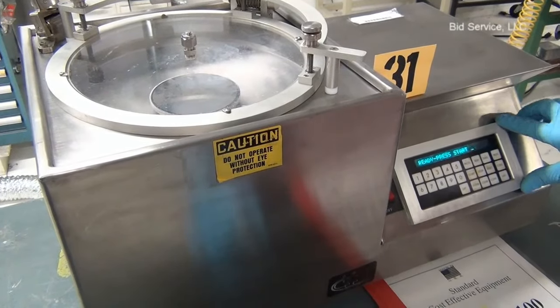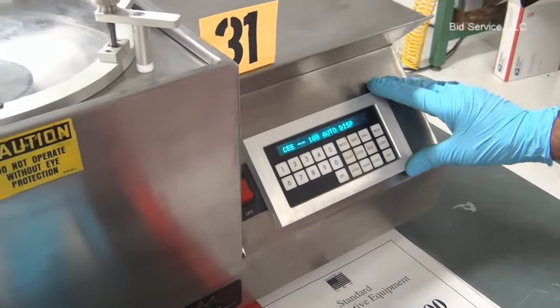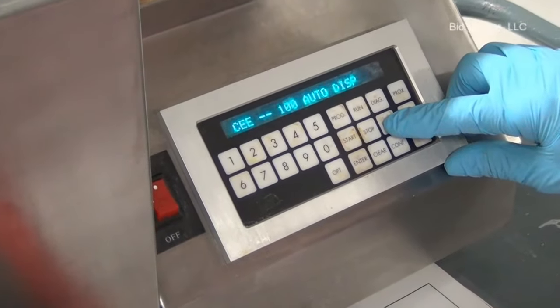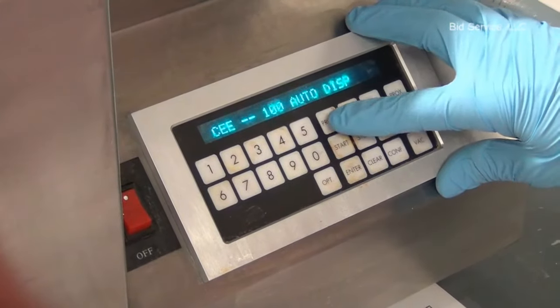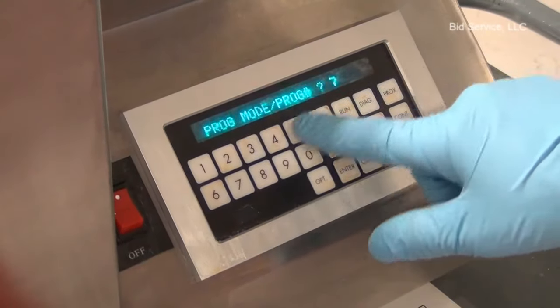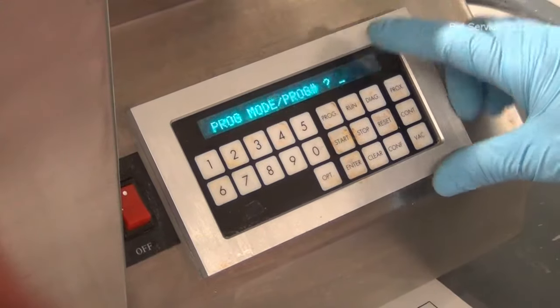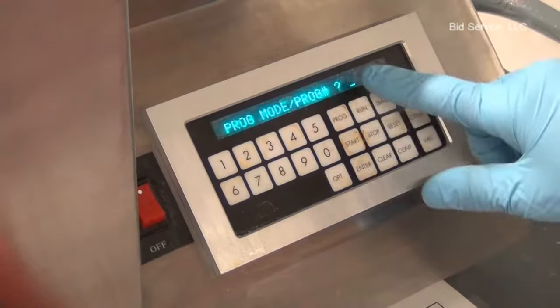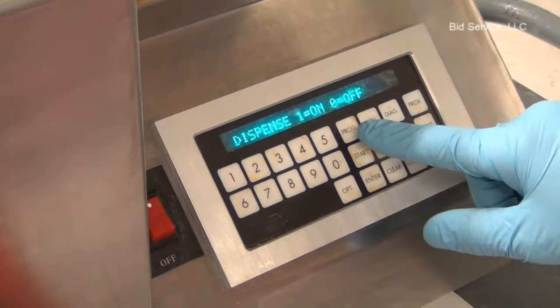The control panel includes a small display with keyboard. The reset button resets the system and displays the model number of the unit. The program button will display the program, and recipes 0 to 9 can be programmed in this. The enter button is used to enter and change a value.